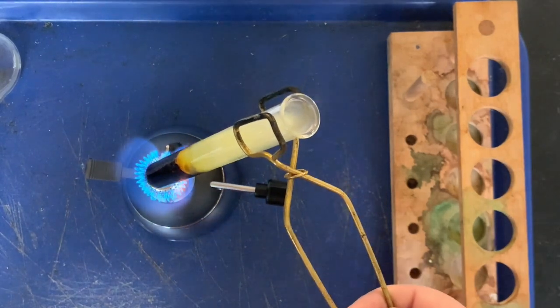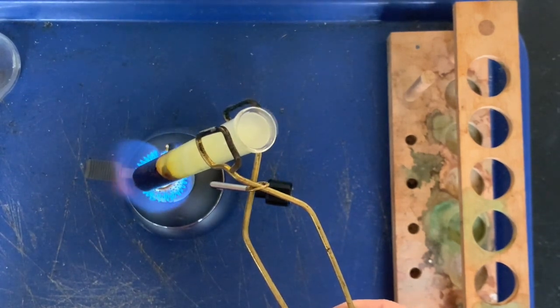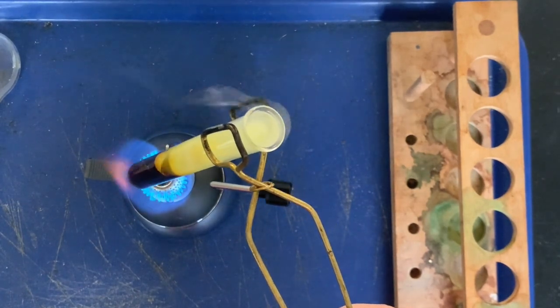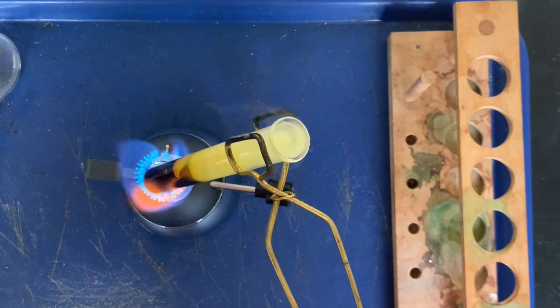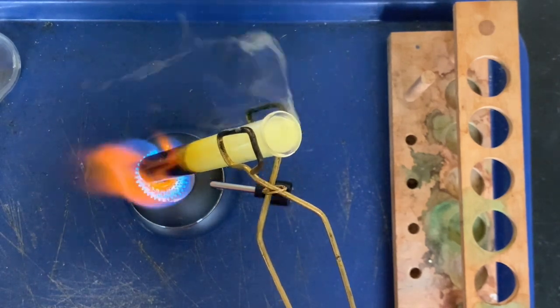Yeah, our mask is helping us filter that out. I see some gas coming out of the top of that test tube. Yeah, definitely, that's a sign of a chemical change. We're gonna let this heat and we'll probably speed up the video a little bit and then we'll slow it down for the last part.